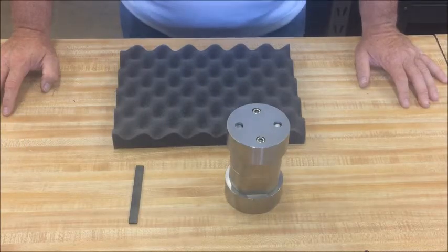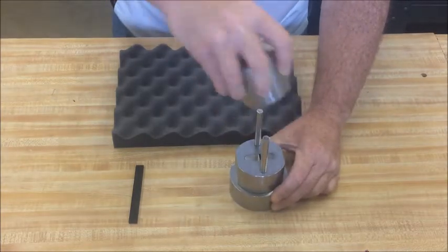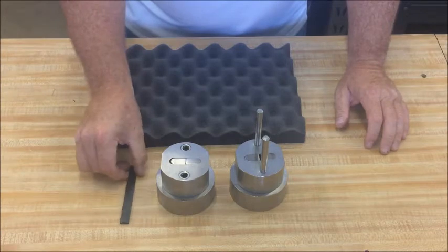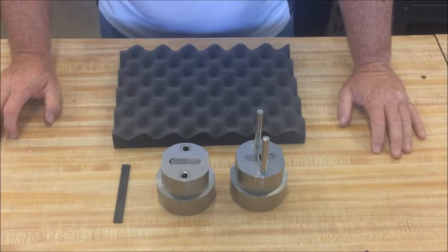Compression loading fixture which consists of two bolsters, an upper and lower bolster, and takes a specimen which is half inch wide and 5.5 inches long.